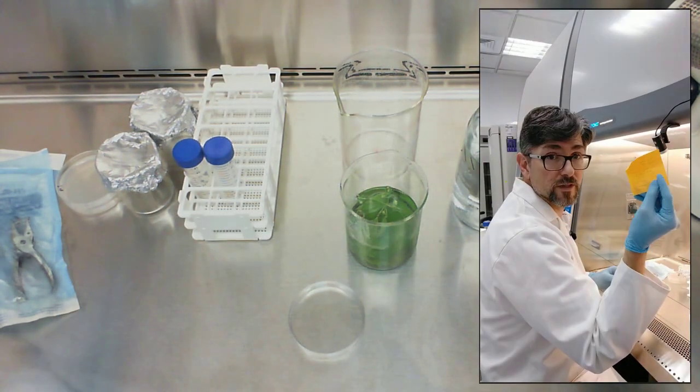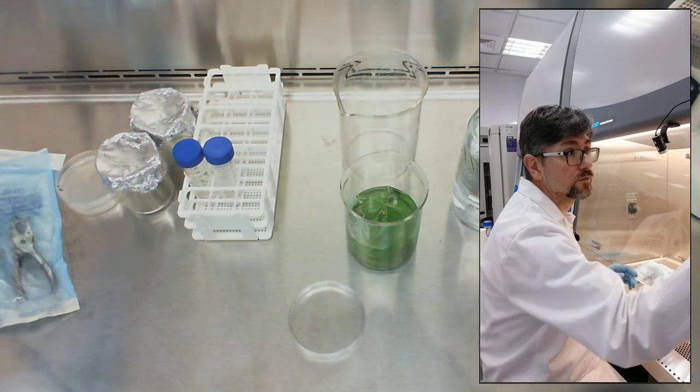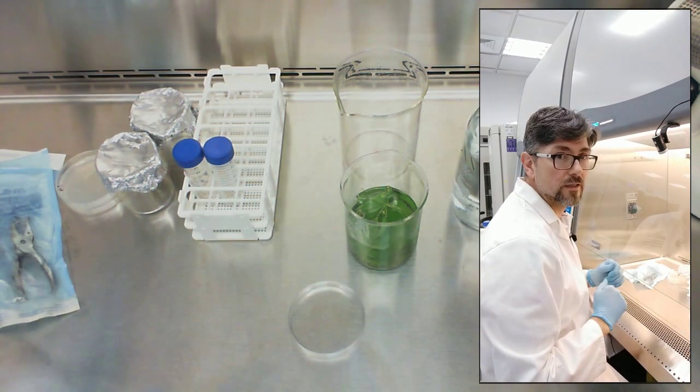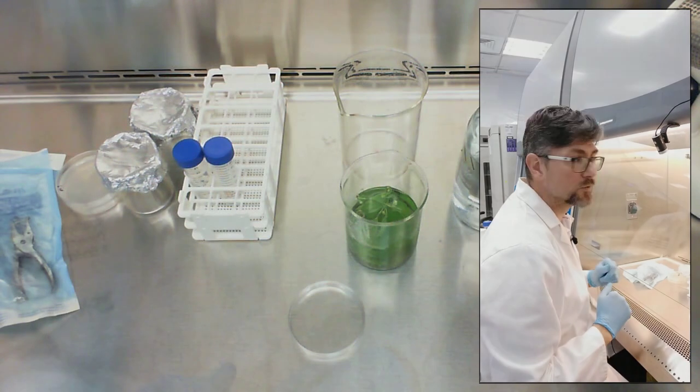I have a procedure right here, a little post-it note stuck right there, and I can follow this and do my procedure.